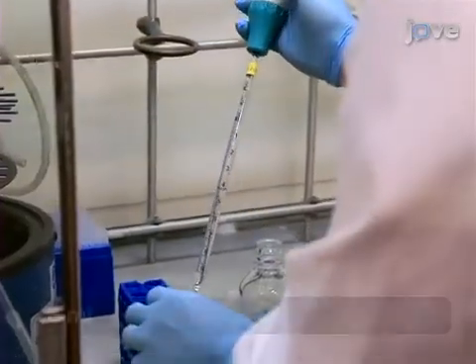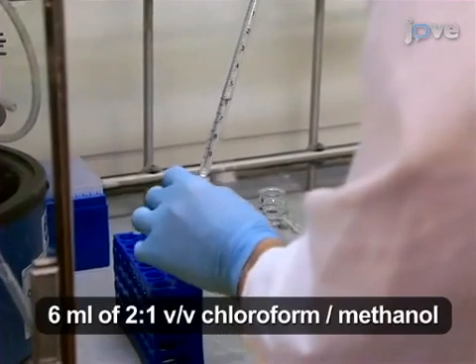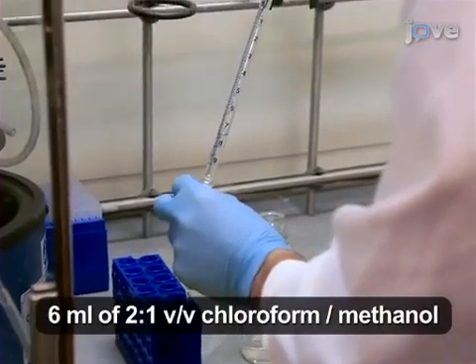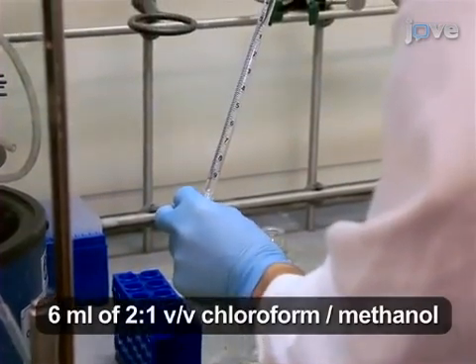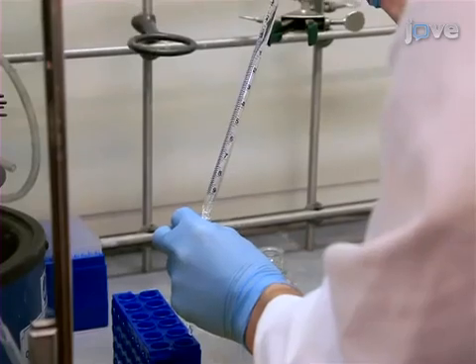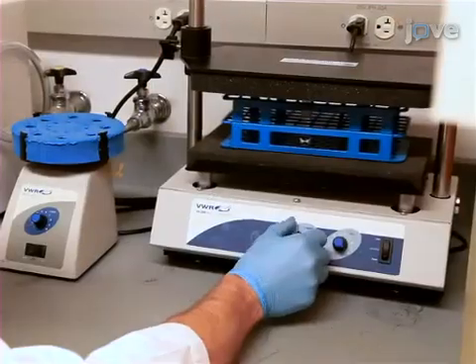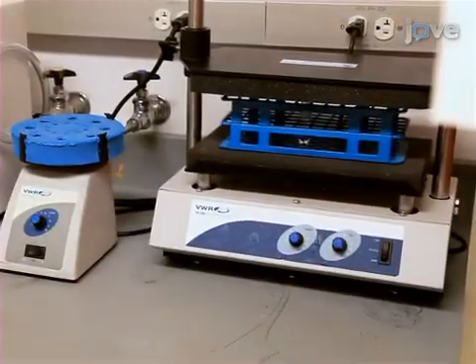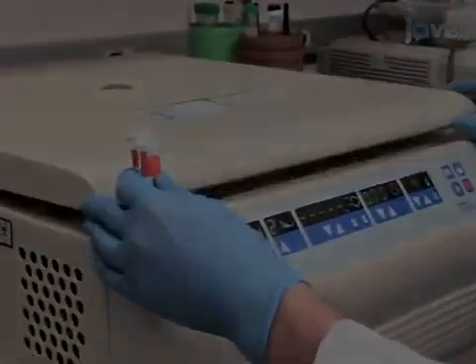Next, add 6 milliliters of 2-to-1 chloroform methanol to each of the 10-milliliter glass tubes containing the samples. Shake the samples on low speed for 30 minutes.